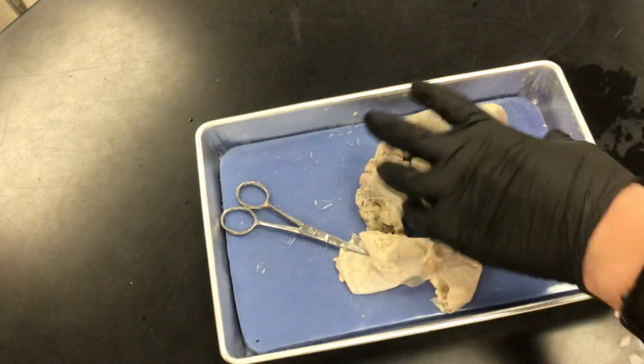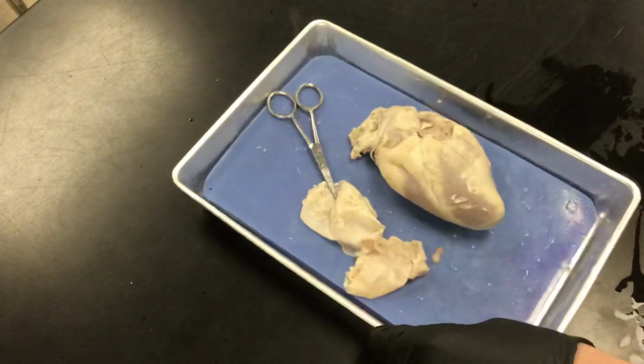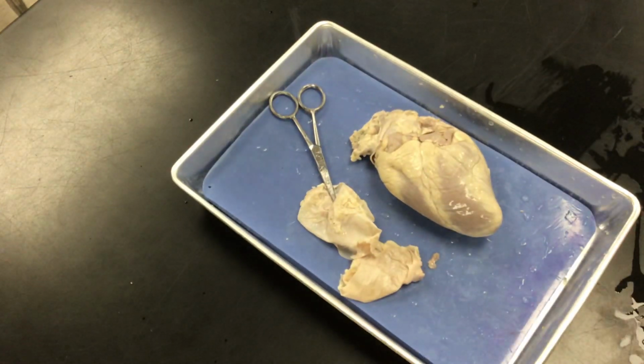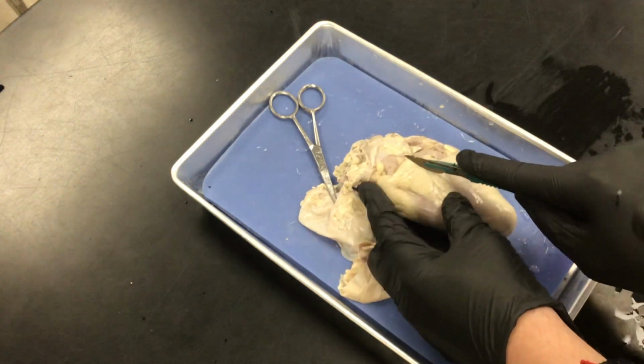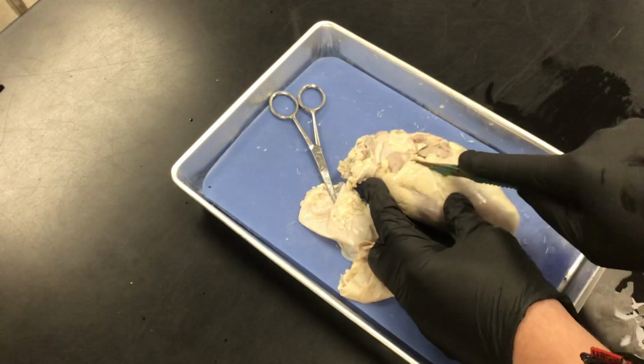Okay, guys, coronary artery. I'll show you. Those are the arteries that go around the outside of the heart like a net. So if you had a stent, like I showed you in class the other day, that's where it would go, into one of those arteries around the outside of your heart. It wouldn't actually go inside of your heart.